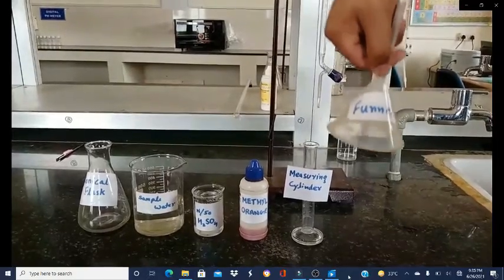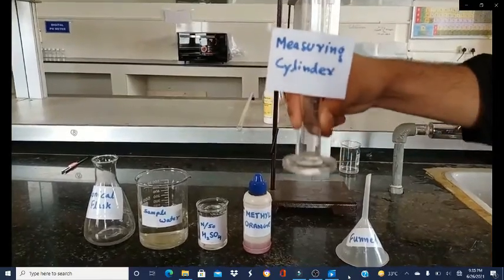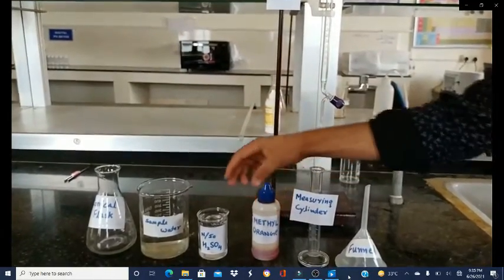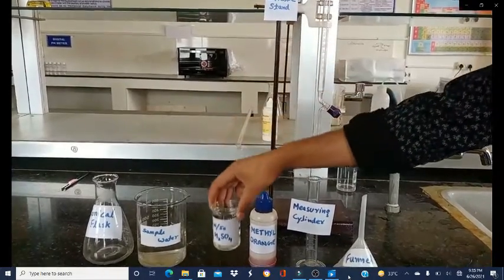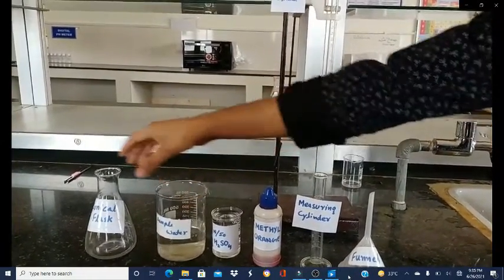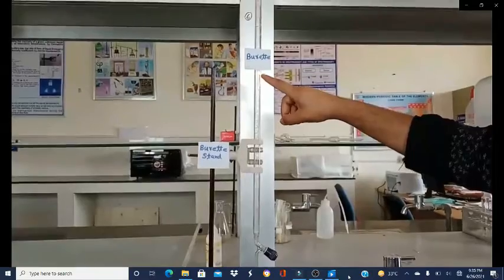These are the apparatus we are going to use during the titration: a funnel and measuring cylinder, methyl orange solution which will be used as the indicator, dilute H₂SO₄ solution with concentration N/50, a sample water which is alkaline in nature, a conical flask for the titration, and a burette held in the burette stand.